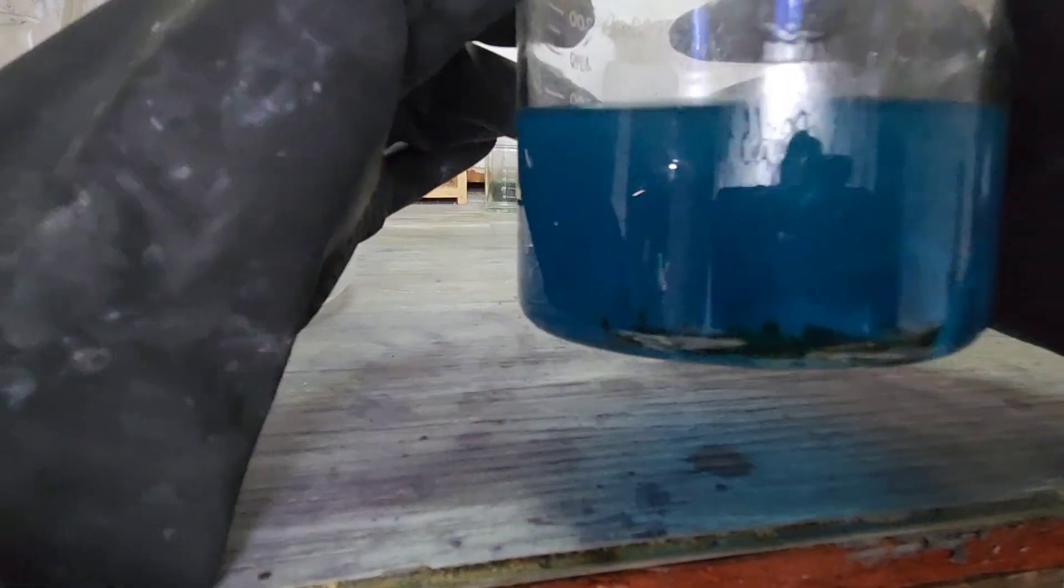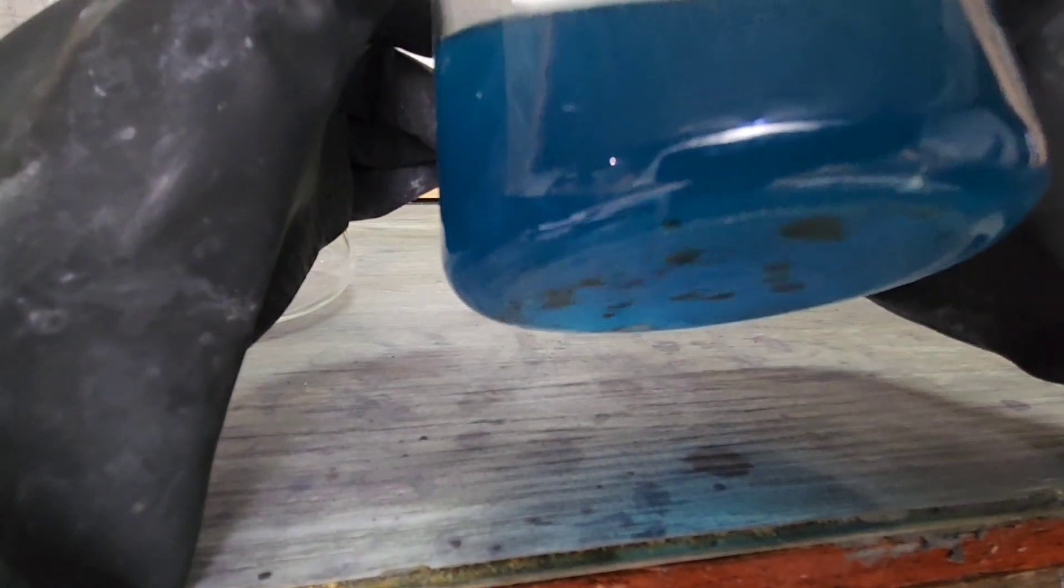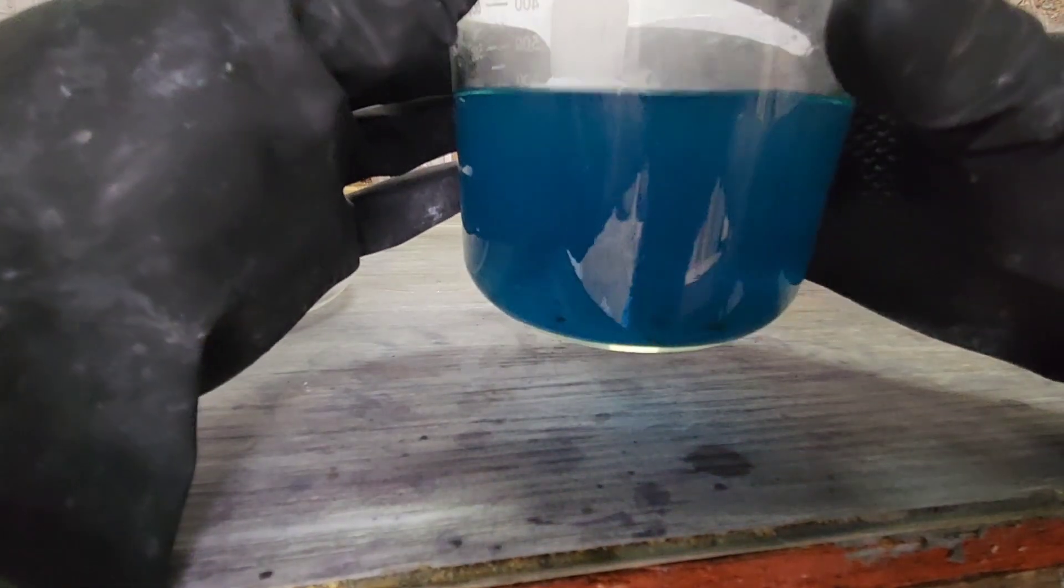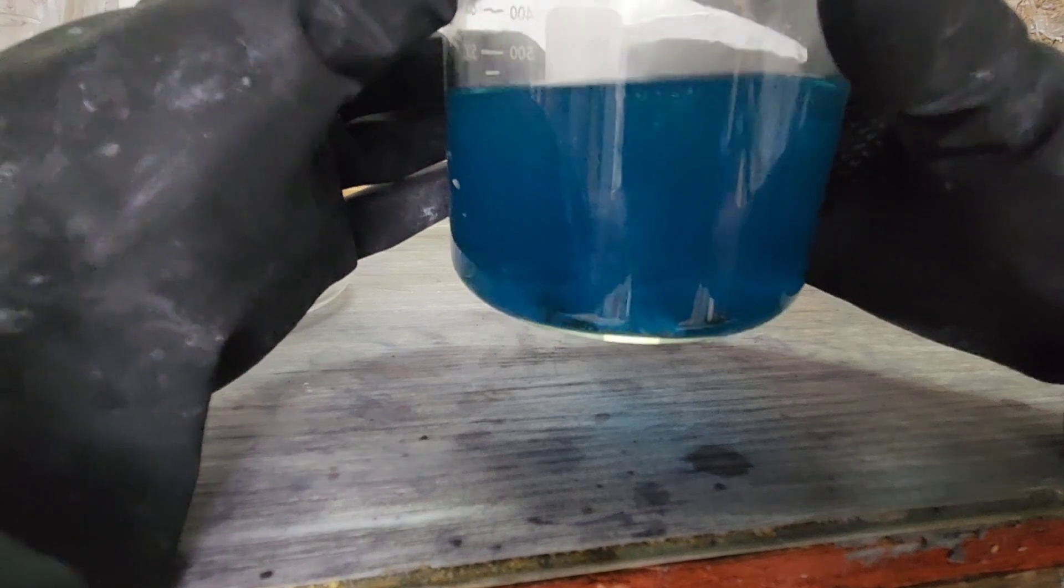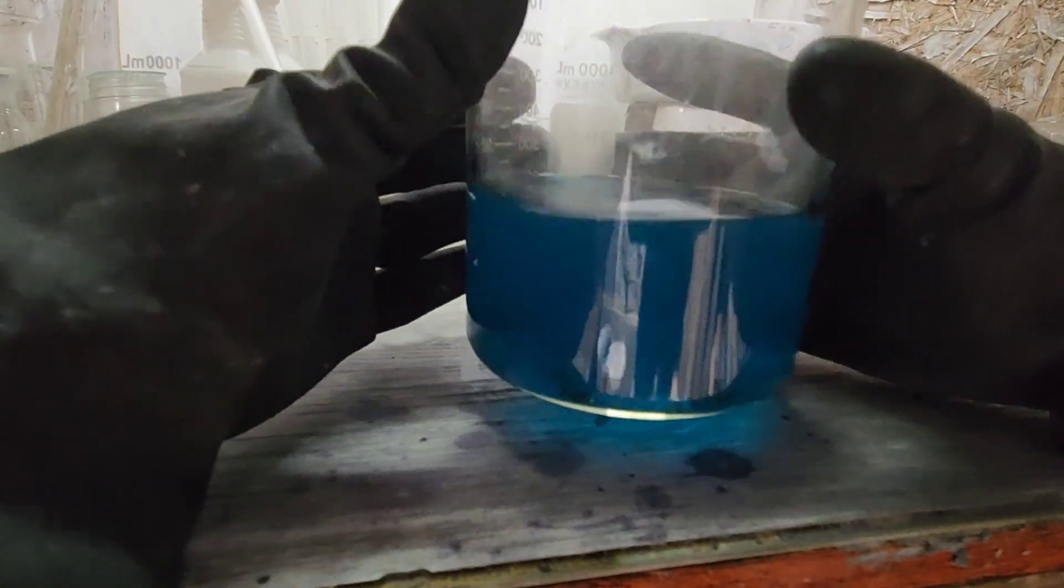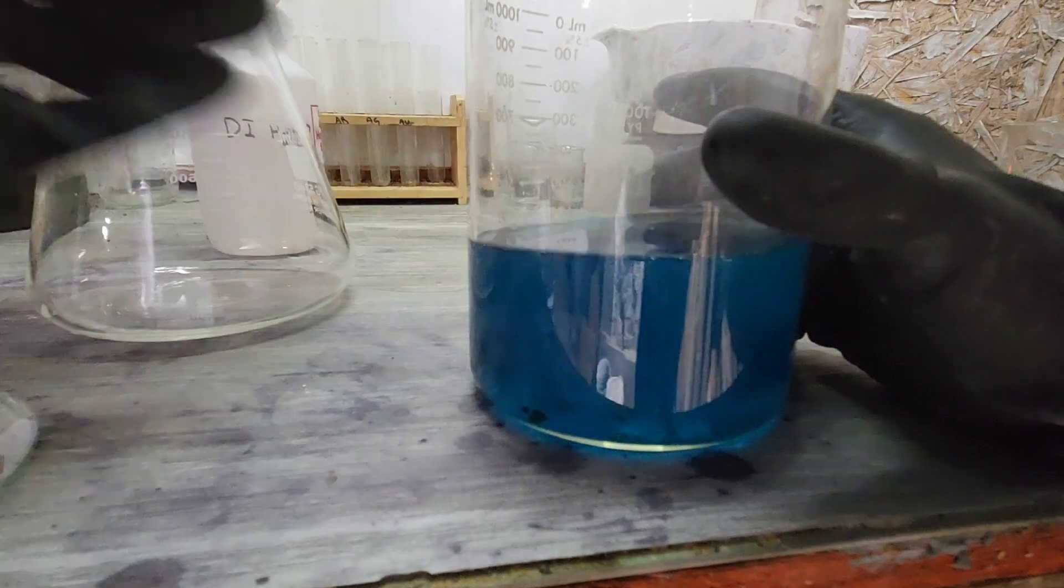Oh no, the fun is gone. And that stuff looks pretty light. So we'll get a better shot at it here.